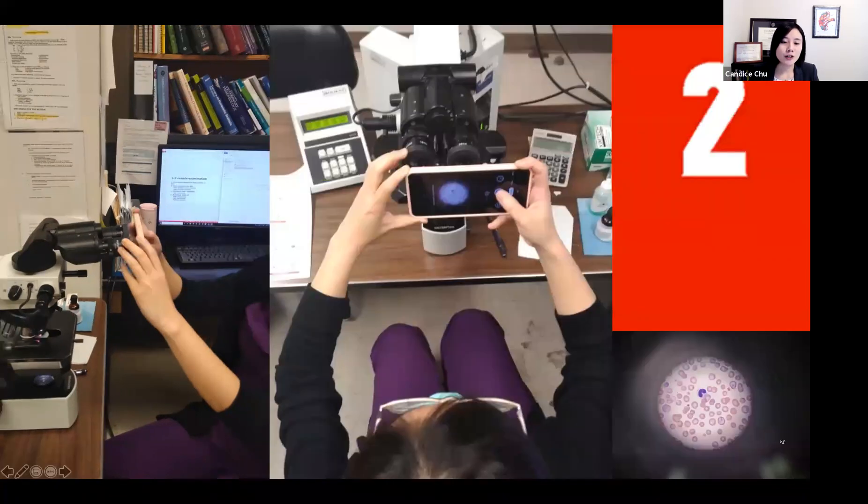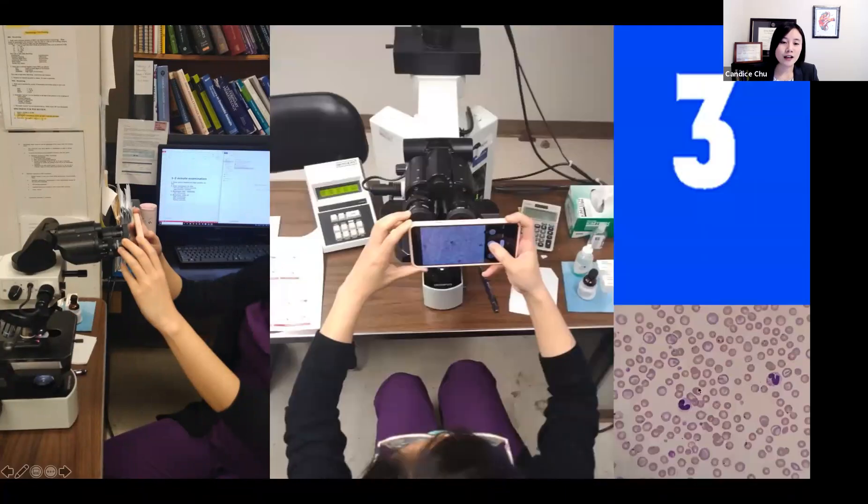And as you move closer, you can start to appreciate the image under the microscope and ultimately you will find the right spot where the image in your microscope fills the whole screen of the cell phone. And notice that at this point, there is still some distance between the microscope and the cell phone.